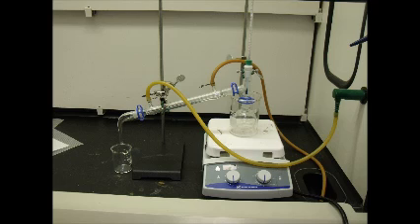Have a receiving beaker be placed inside of a larger beaker filled with ice at the end of the apparatus so as to prevent the distilled liquid from converting back into a gas. Keep that end pointed off to the side. Attach the hose at the end closer to the receiving beaker and hook it up to the faucet of the sink. Place the end of the other hose so it drains into a sink.